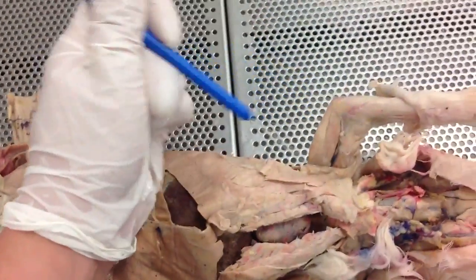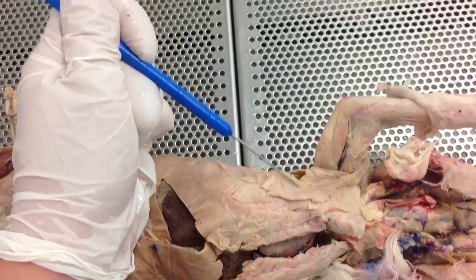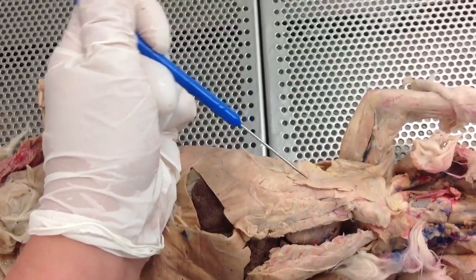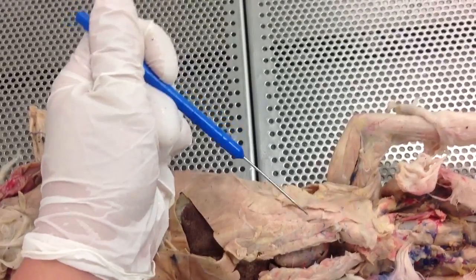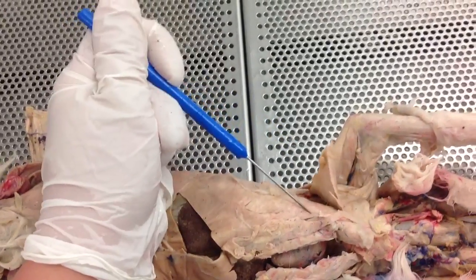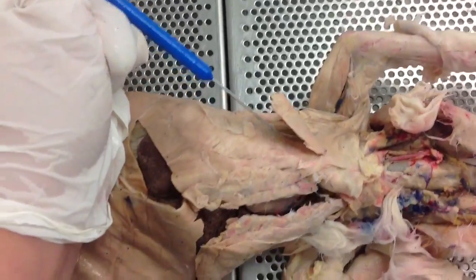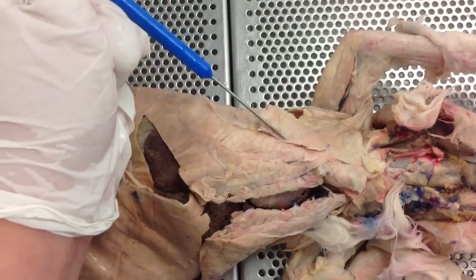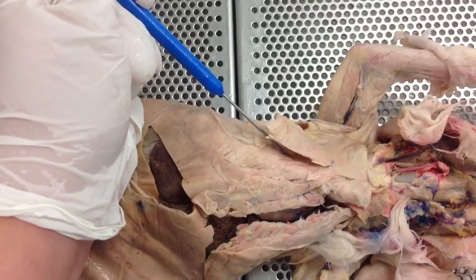Move the rabbit onto its chest. This flap of skin here is going to be your pectoralis superficialis — superficial implying that it's on the outside. We flip it open. This section right here is going to be your pectoralis profundis. So pectoralis superficialis, and the inside portion is your pectoralis profundis.